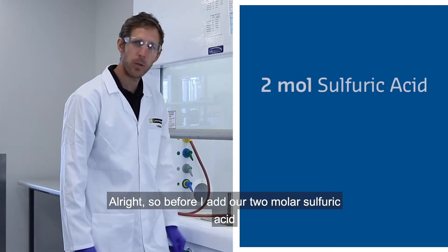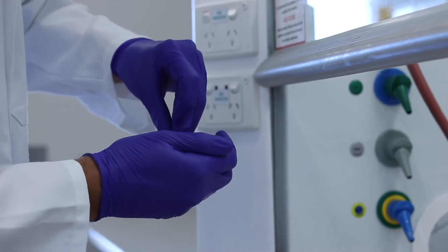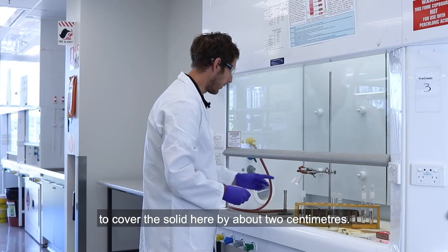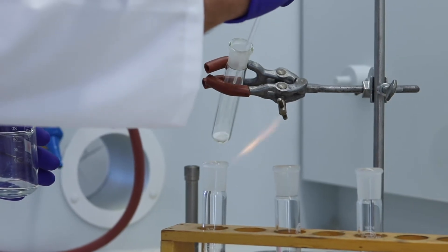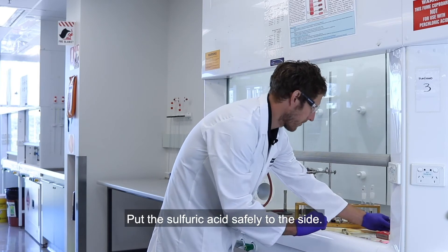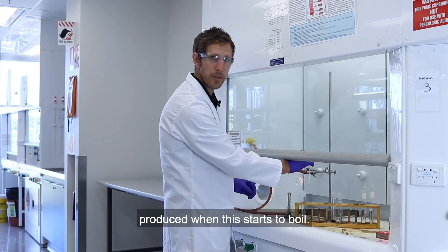Before I add our 2 molar sulfuric acid into approximately 2 grams of sodium sulfite, I'm going to light our Bunsen burner. I'm now going to add in enough sulfuric acid to cover the solid by about 2 centimeters, then put the sulfuric acid safely to the side, stopper our vessel, and apply heat. We know the sulfur dioxide has been produced when this starts to boil.